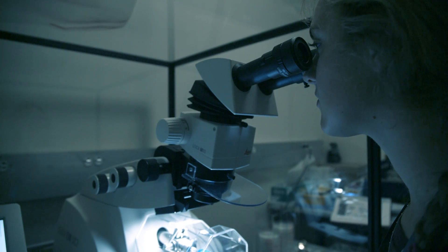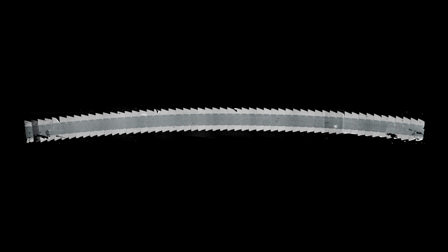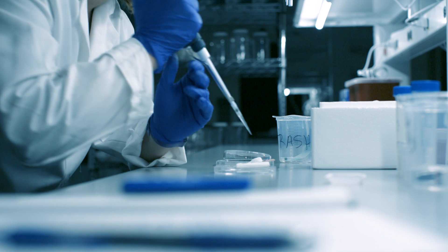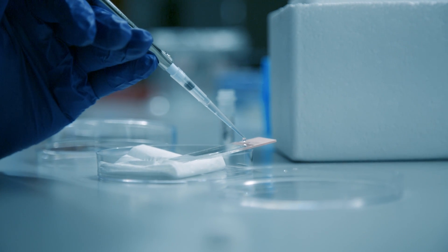We then cut the tissue with a diamond knife, very thin, so we have a very in-depth look at each of these slices. We collect them in a way that they form a kind of ribbon or an array — which is where the 'array' in array tomography comes from. You have this set of sections laid out like frames on a film tape, here on an optical cover slip.